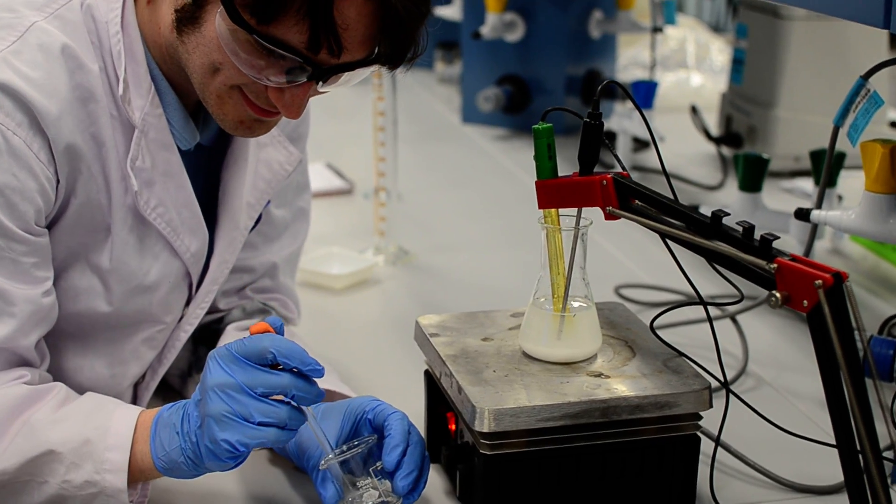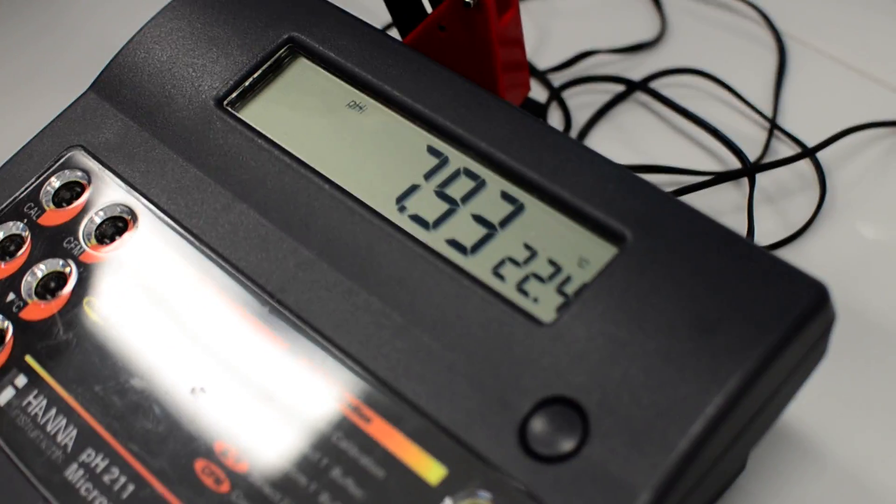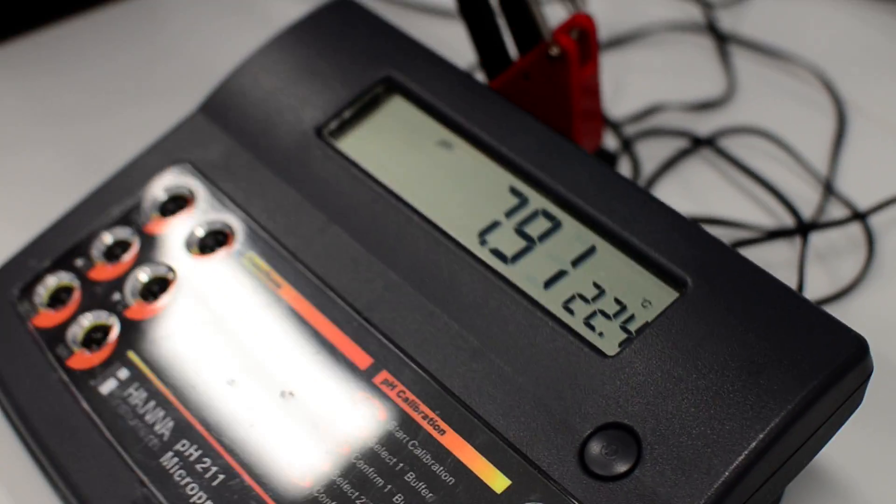Frustrated. Quite frustrated. Dave has to get to pH 8 exactly, and according to him the isoelectric point is going to jump up. I'm going to guess it is at 8.